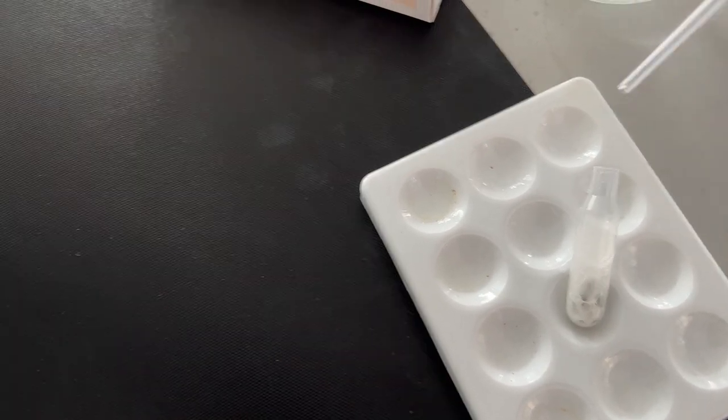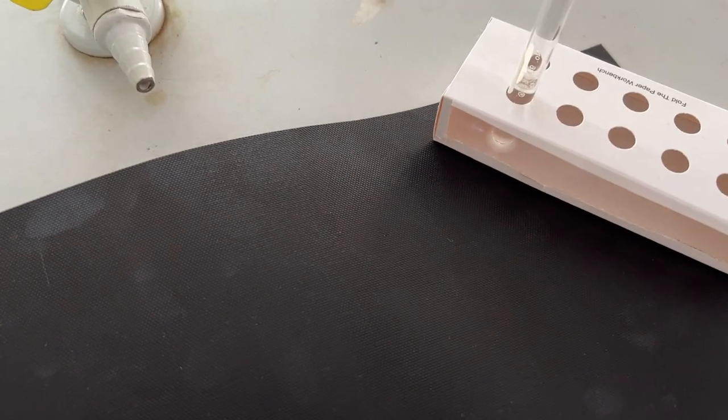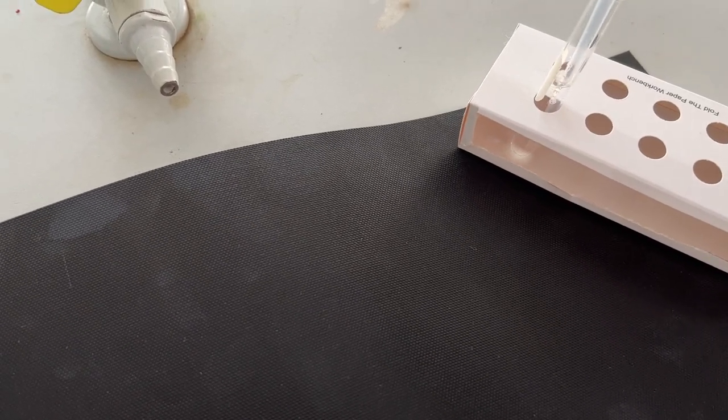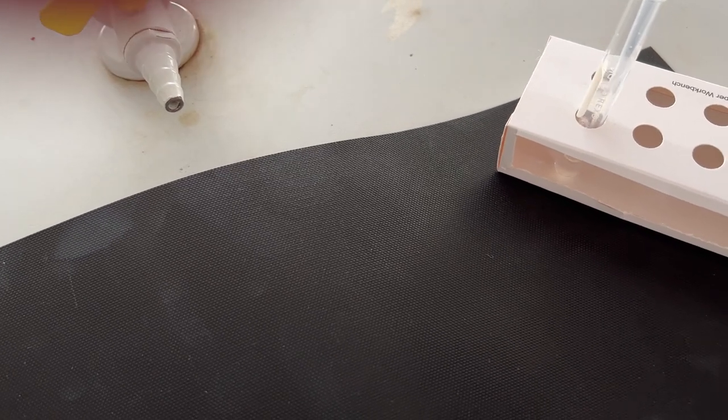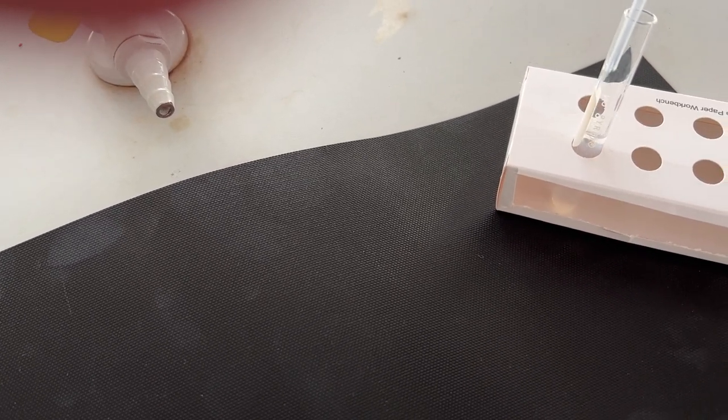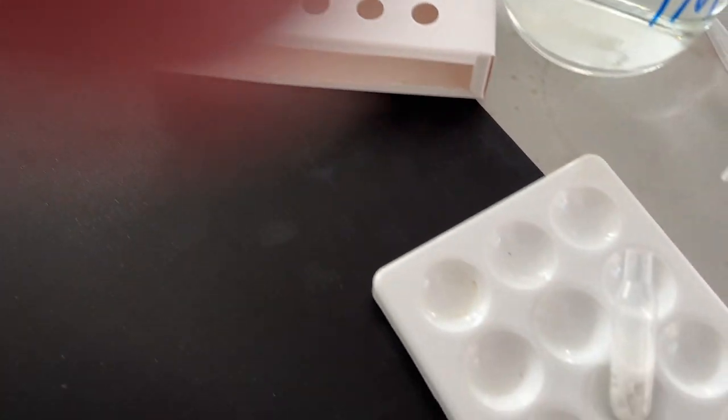And this time we bubble into a small tube of lime water, down to the bottom.